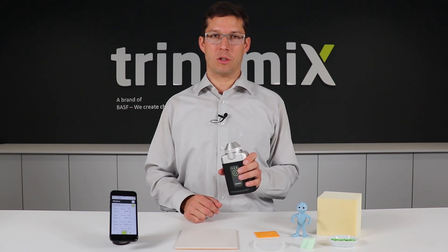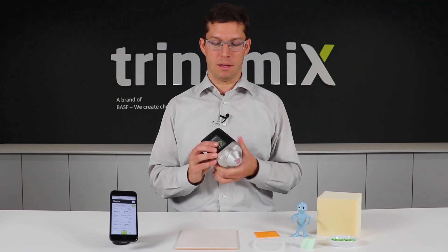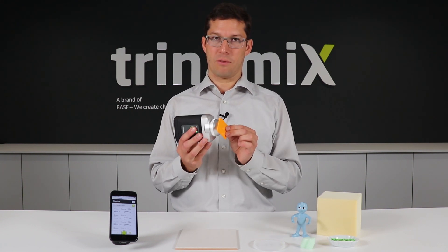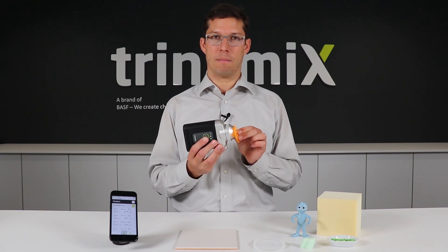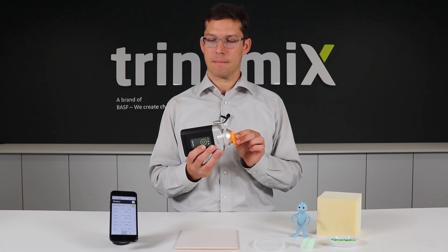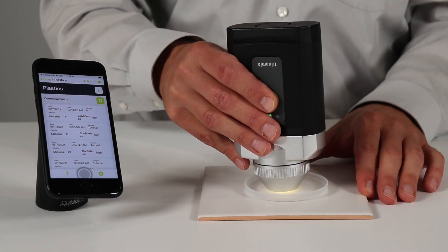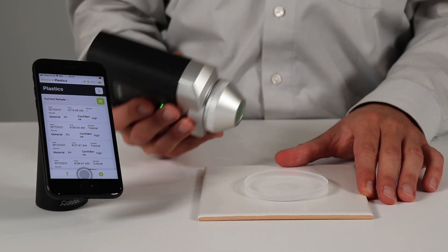In order to perform a measurement, it's very easy to use. You have one button in the front. You push the sample in front of the measuring head and you start the measuring by pushing the button. Let's test a couple of samples to show you how this works.